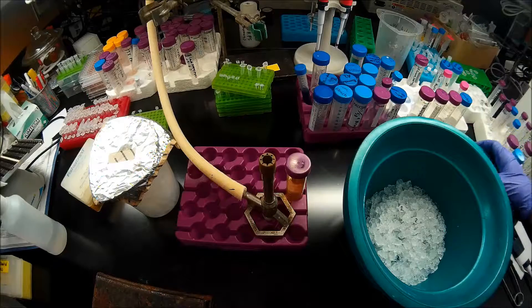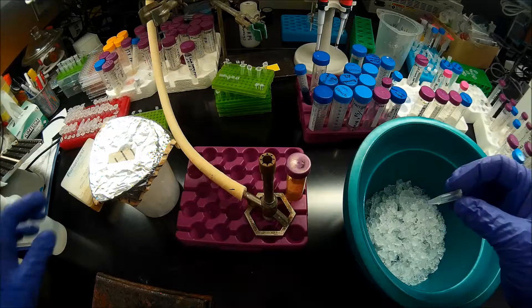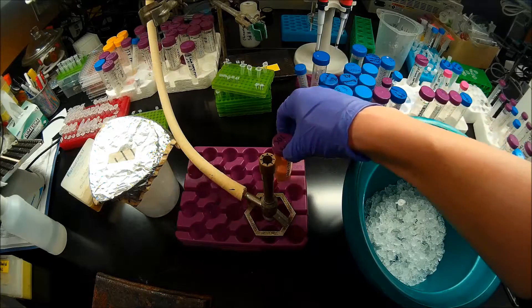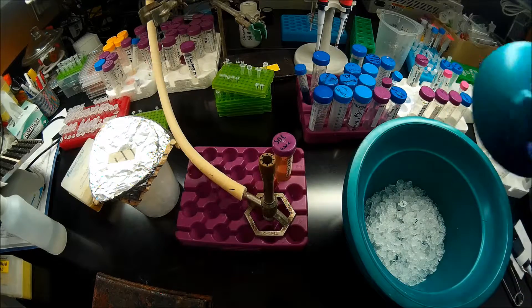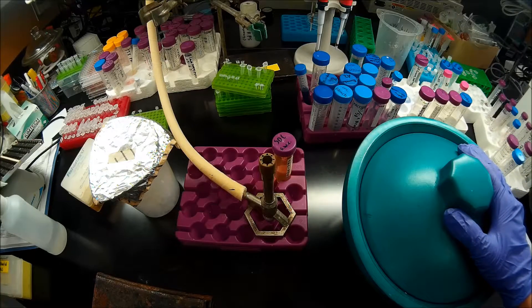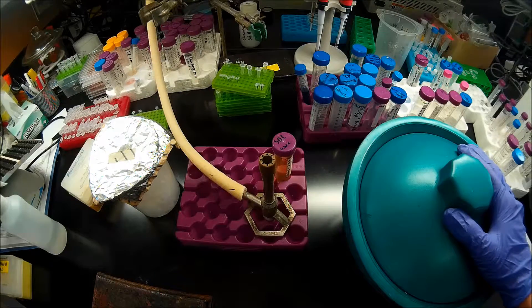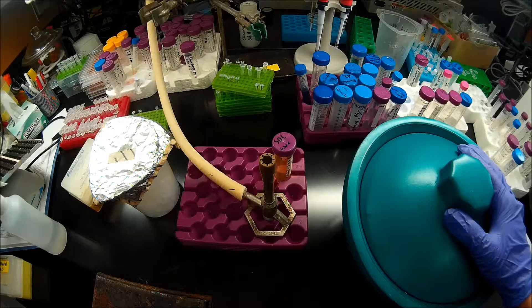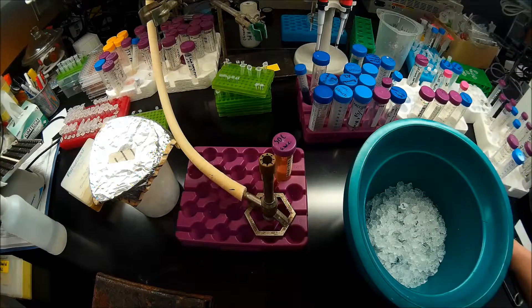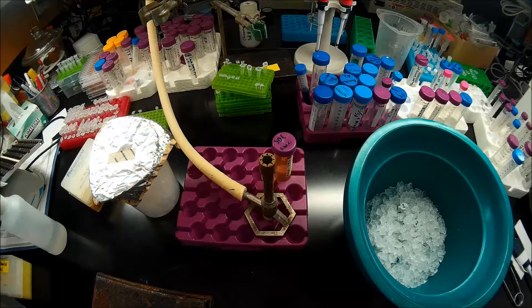After about 2 to 5 minutes, we're now ready to dispense our transformed cells either onto a plate or into SOC for a recovery step. The beauty of Zymo's Mix and Go cells, or Z-Comp cells as we call them, is that you don't actually need a heat shock, and if you're transforming with basically an ampicillin-resistant plasmid, you do not need to do an outgrow or a recovery step. I'm going to do that today because I'm transforming with a ligation mixture, and I want to maximize my transformation efficiency.